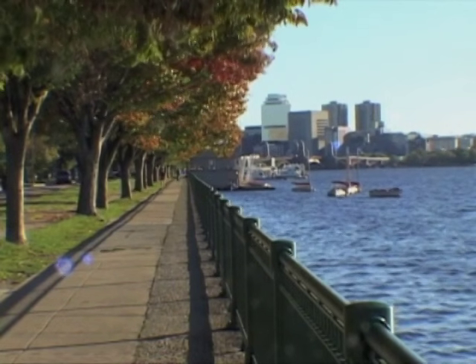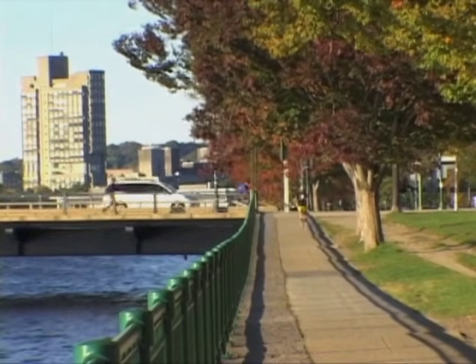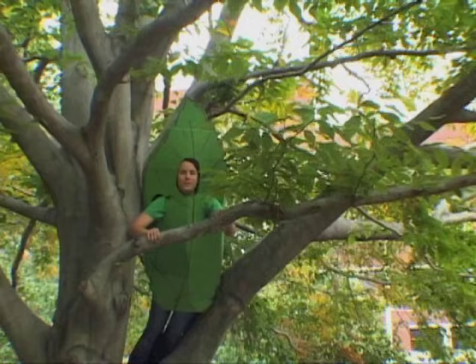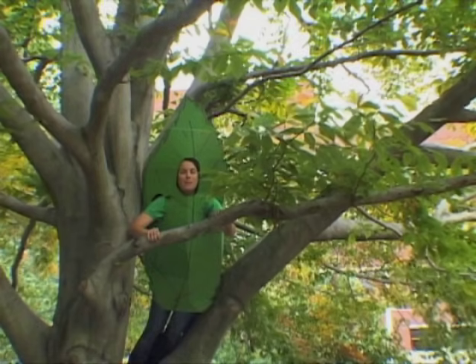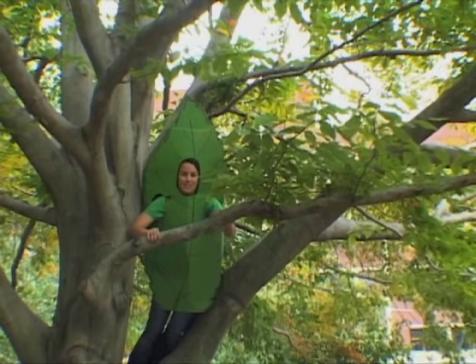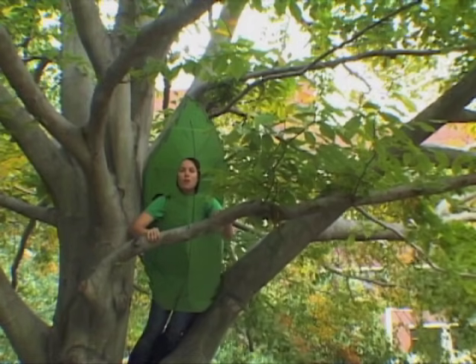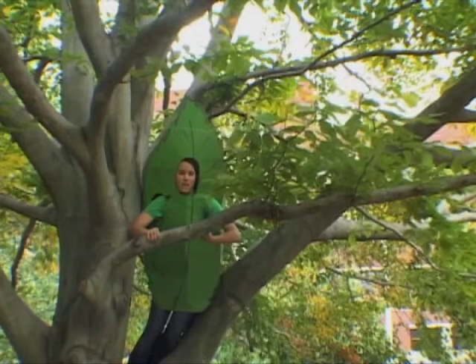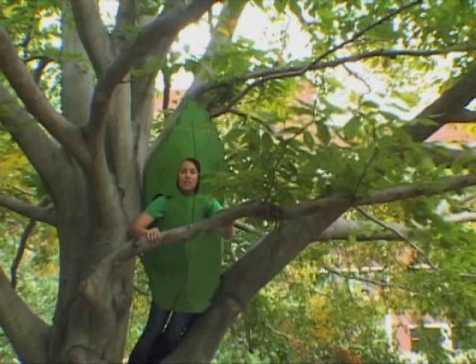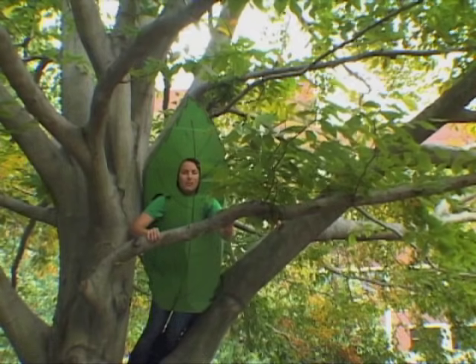It's fall in New England, the time of year when all the leaves change from green to red, yellow and orange. But did you ever wonder why that transition happens? Hi, I'm Chlorophyll, the pigment that gives leaves their characteristic green color. I'm on a mission to find out why every year in the fall the leaves change from this beautiful green shade to all of those other colors. My friend Brad is going to show us how to find out exactly why all of those color changes happen.